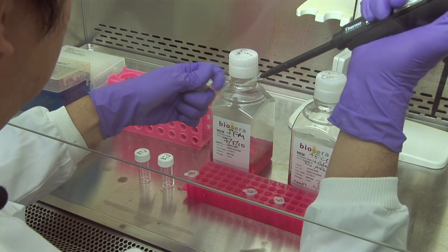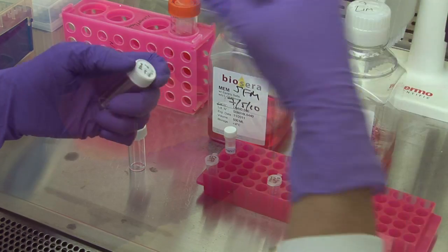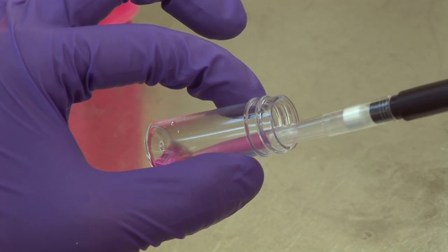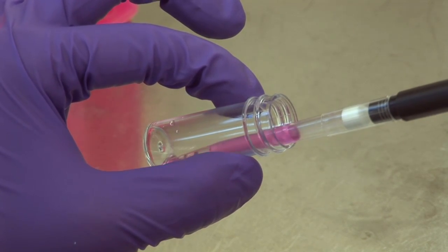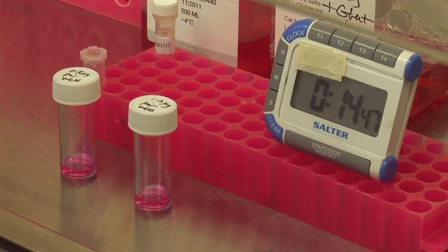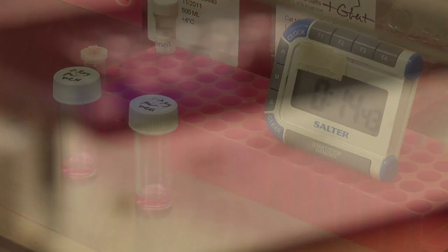Pipette the calculated volume of NT-Mag into a tube. Add the DNA solution to the tube containing the NT-Mag and mix by pipetting up and down 5 times. Leave for 15 minutes to allow formation of the DNA nanoparticle complex.